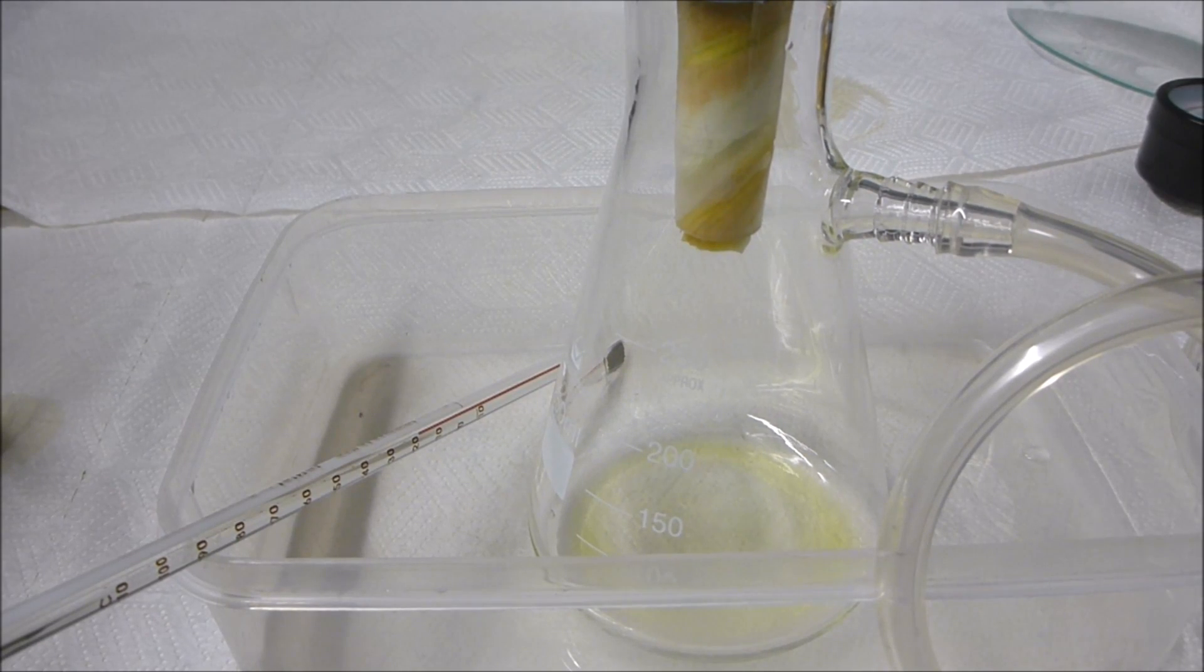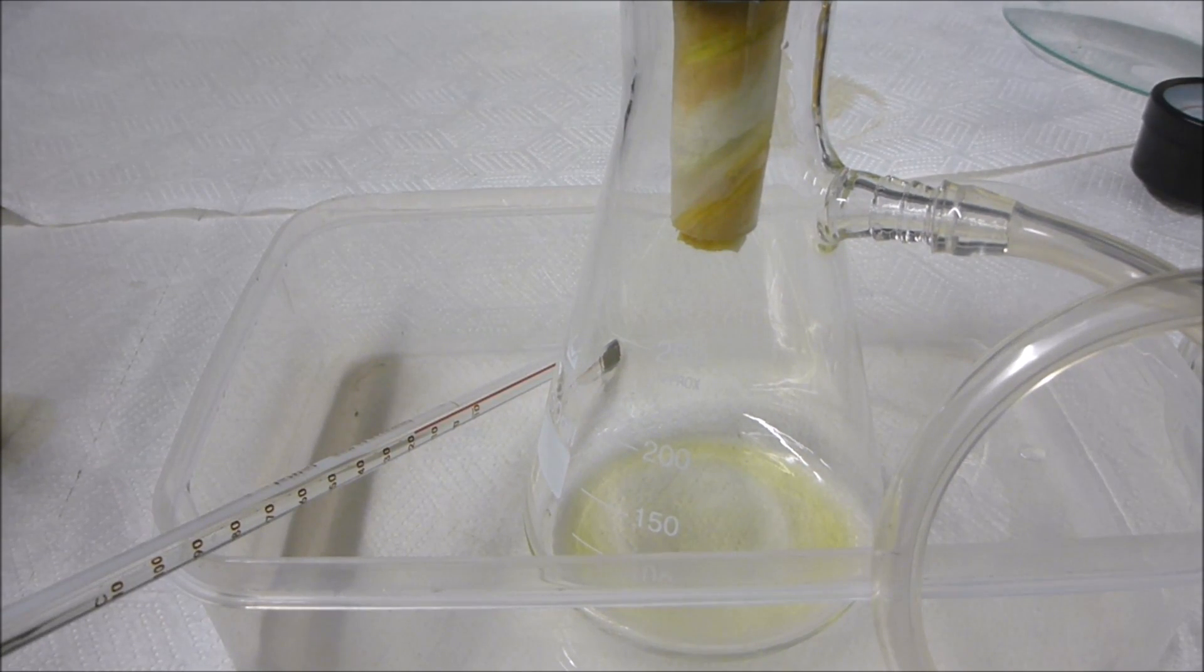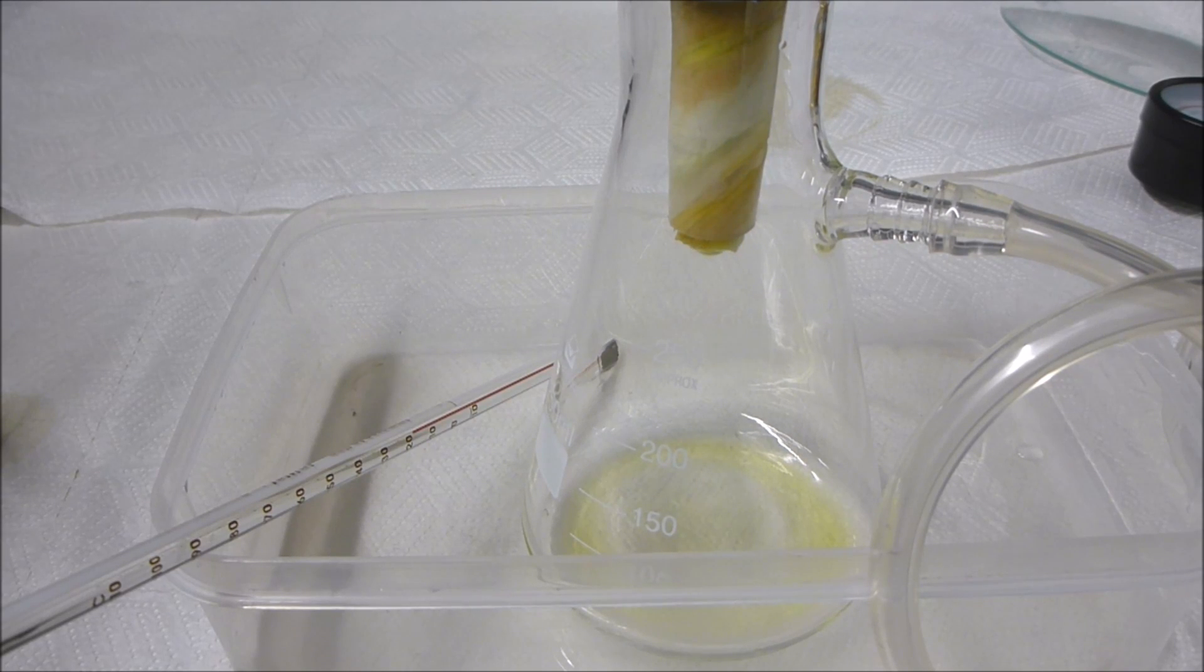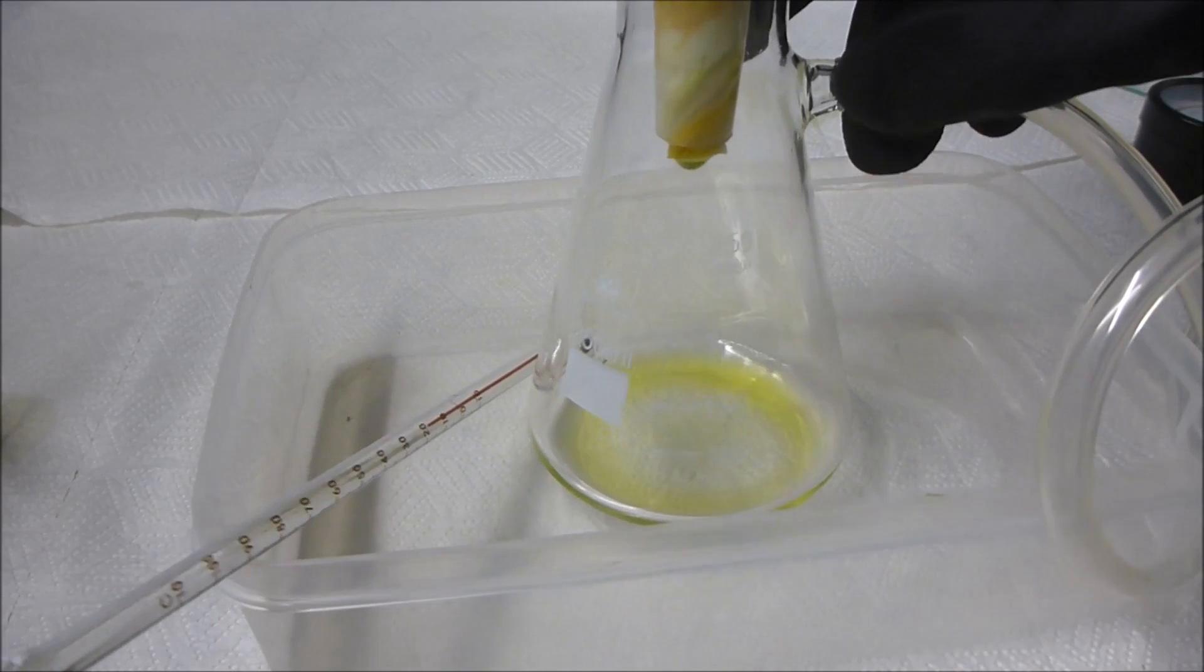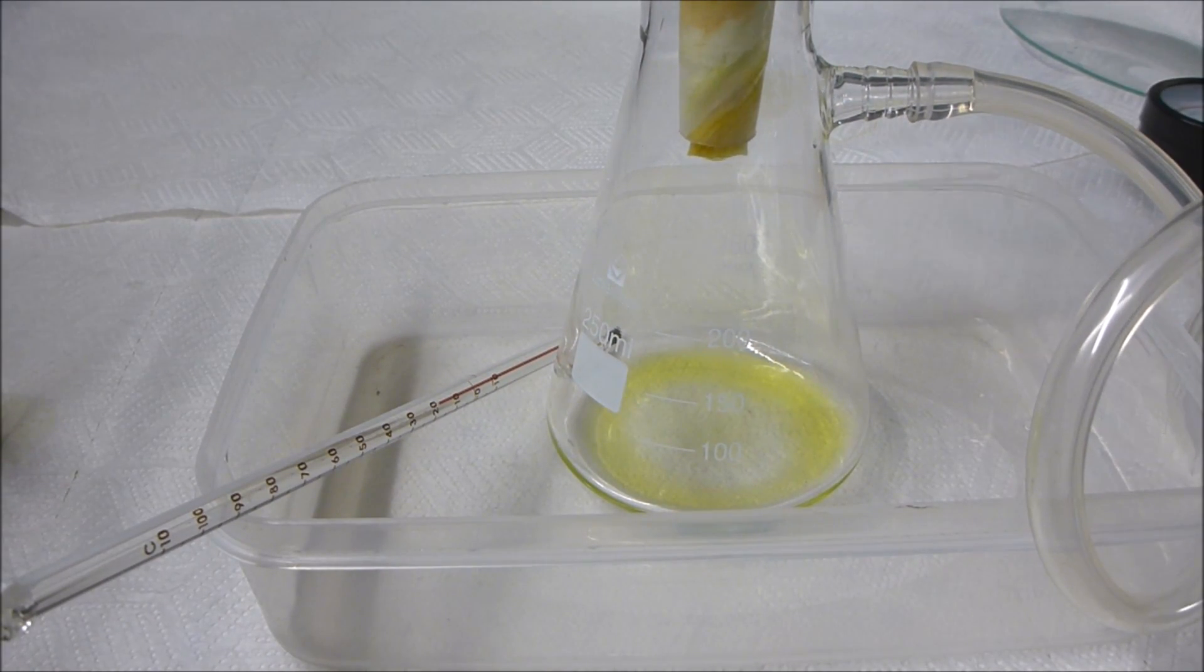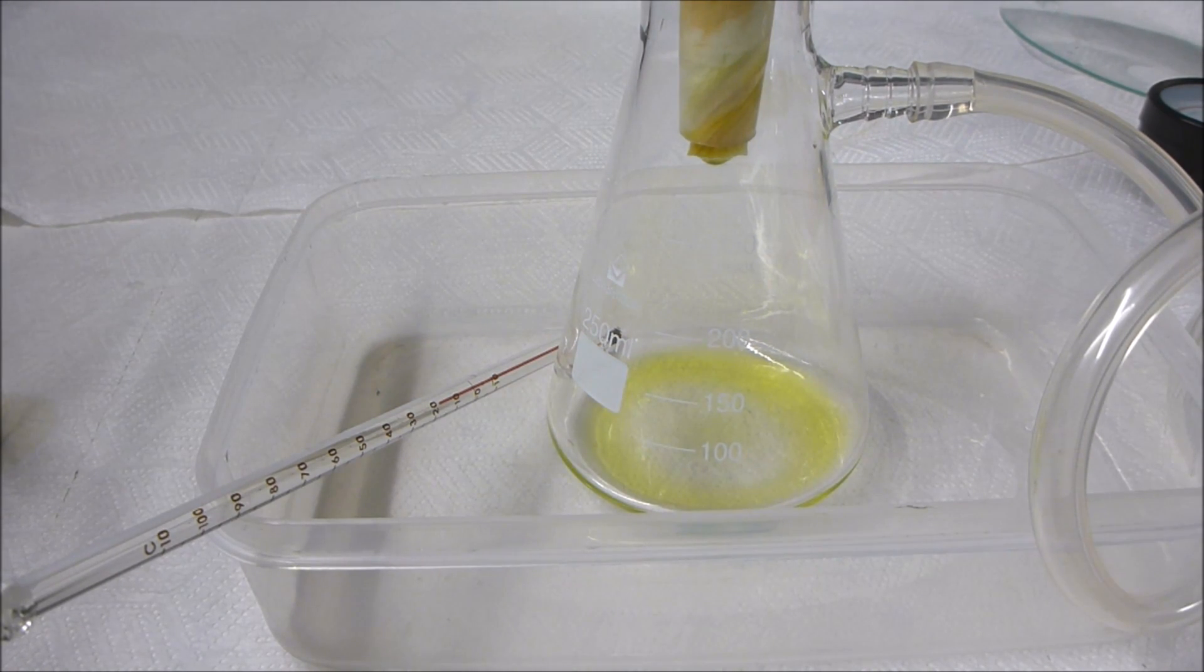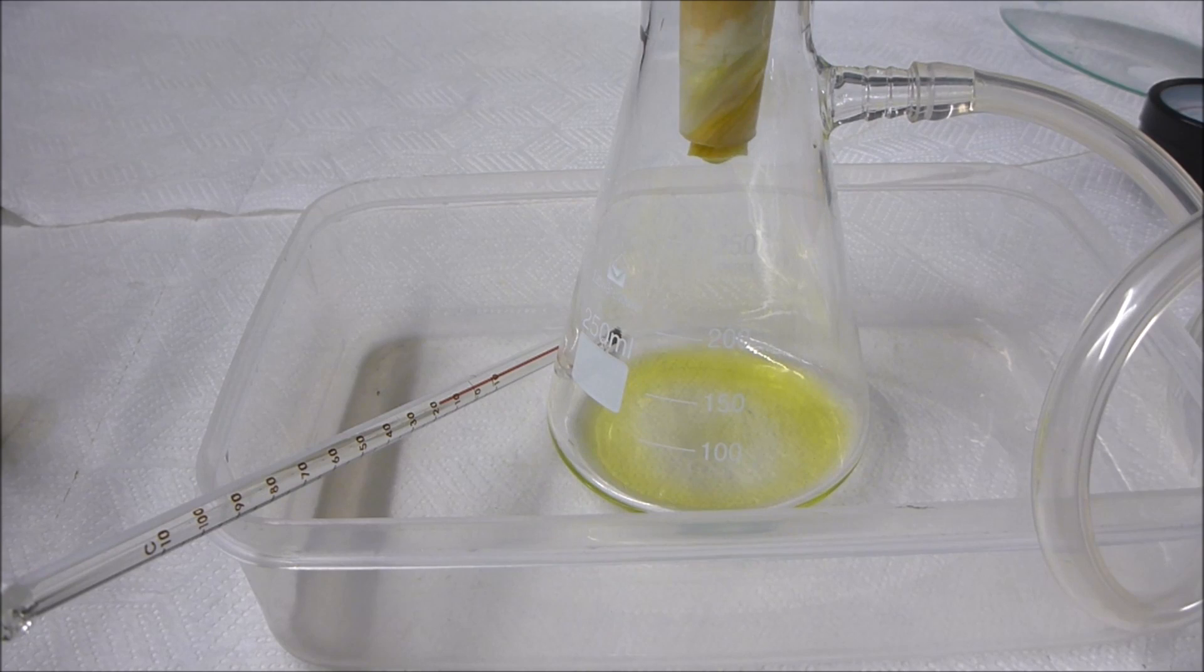You will notice that it's dripping quite slowly, but the key here is that the solution is coming out very very clean. Obviously the solution has already had time to cool, which means that any salts that can stay in a warm solution but are going to come out when it cools already precipitated out and they should be filtered out no problem. It is now exactly 8 p.m. here so we can have a look at how long it basically takes to filter this hundred milliliters of solution.